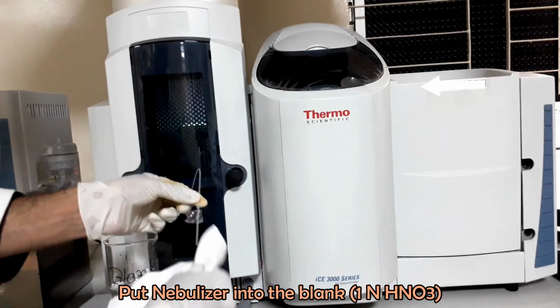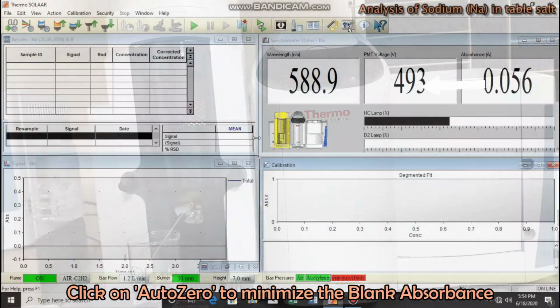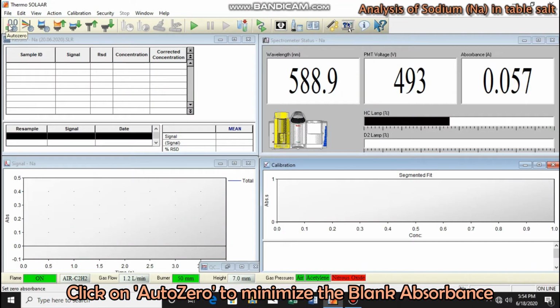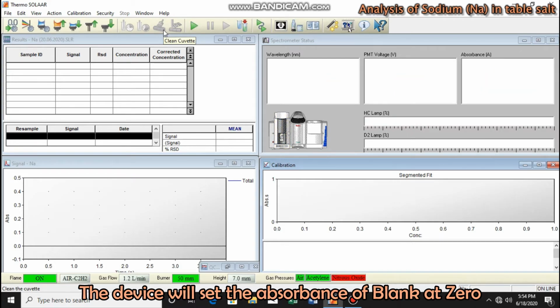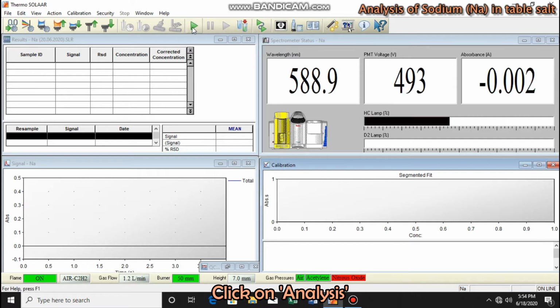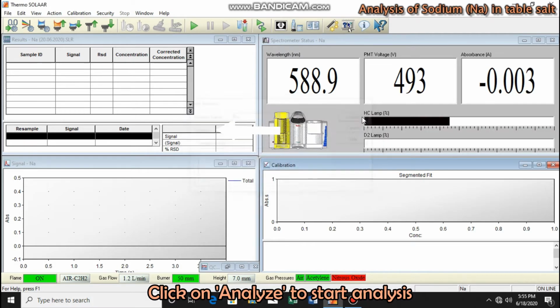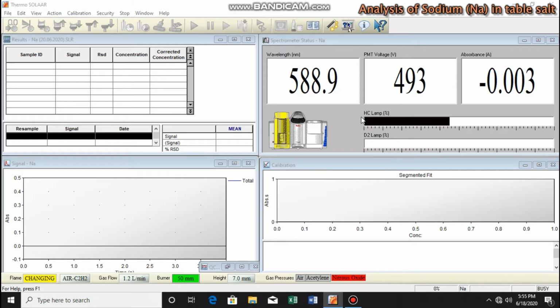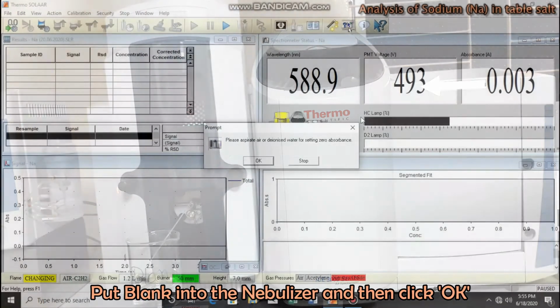Put the nebulizer into the diluent that we used for standard preparation. Click on Auto Zero. This option will minimize the absorbance of the diluent. Click on Analyze icon and set the analysis name. And click on Analyze option. The instrument is asking for air. Keep the nebulizer into the diluent and click on OK.